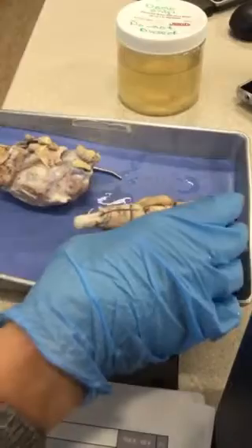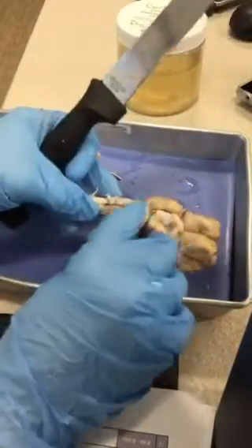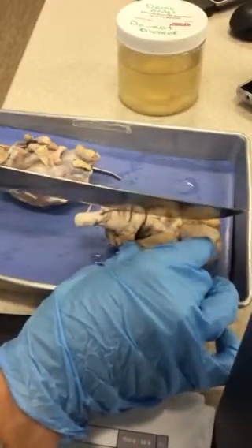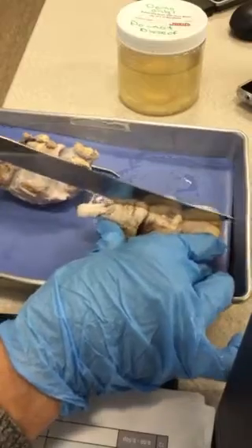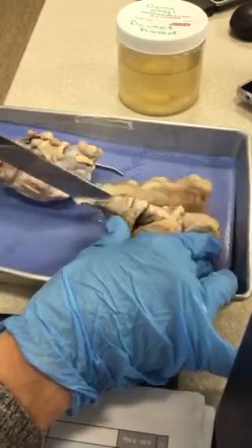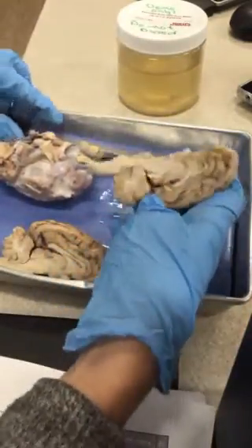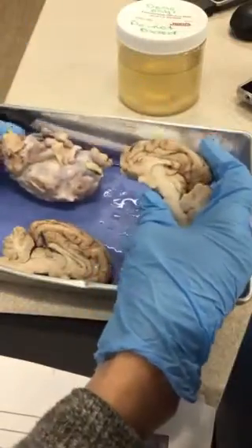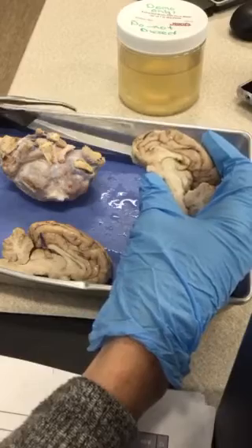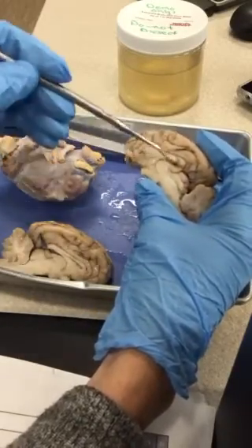So the best way to cut is to lay the sheep brain down like this and try to center your knife down that vessel that runs down the middle of the medulla and right through the optic chiasma, and then a gentle kind of sawing action straight down, and you'll get a nice, hopefully, sagittal view. Mine wasn't very good. But try to be as careful as you can and slow. And then we can start to look at some of these structures here.